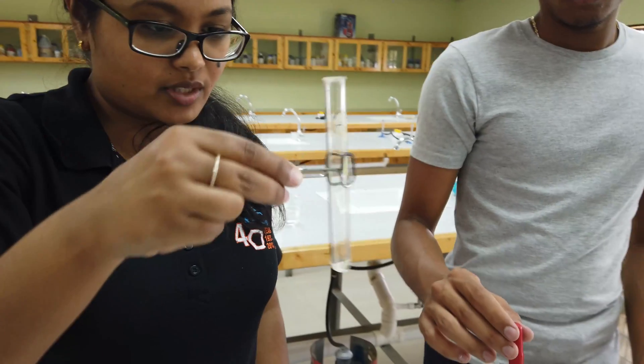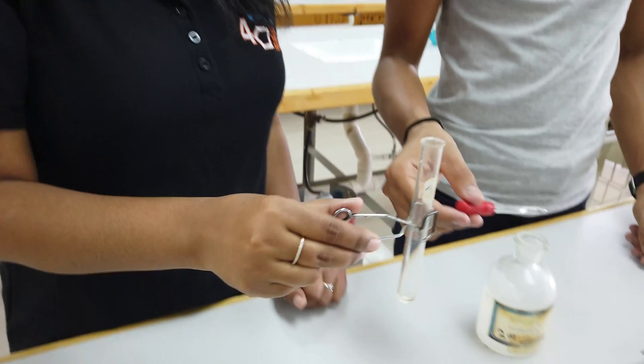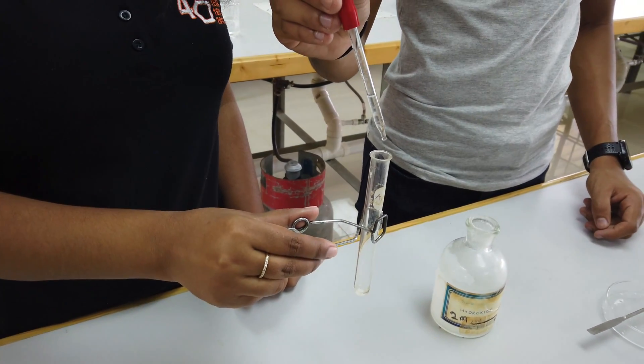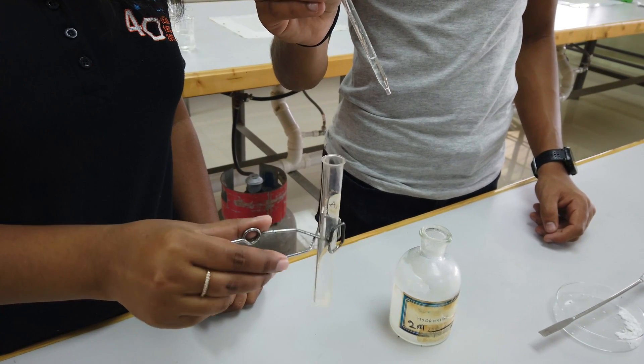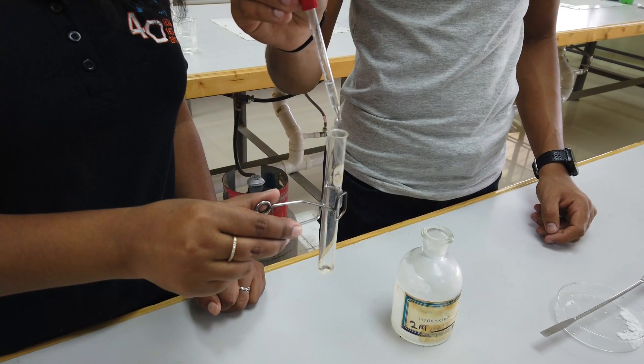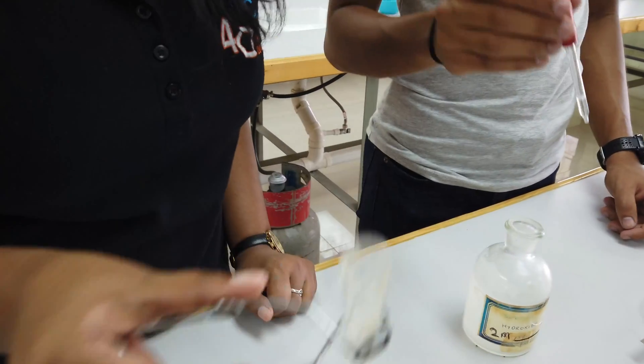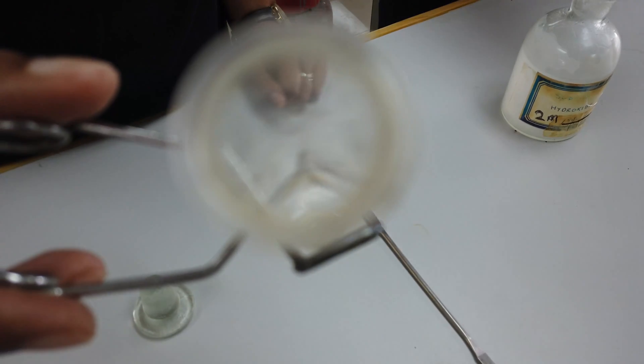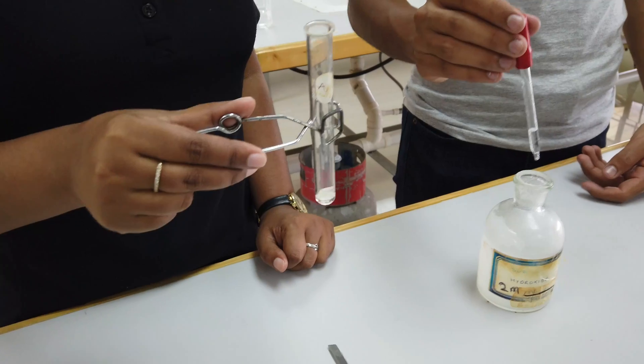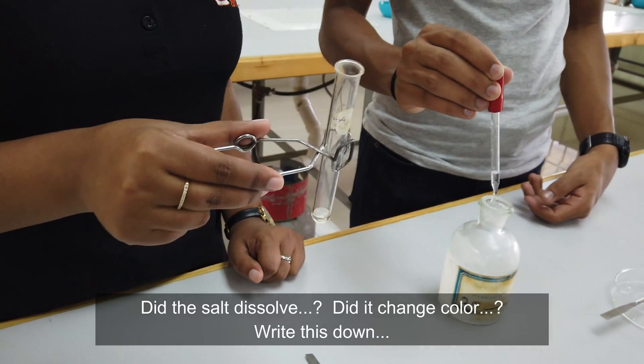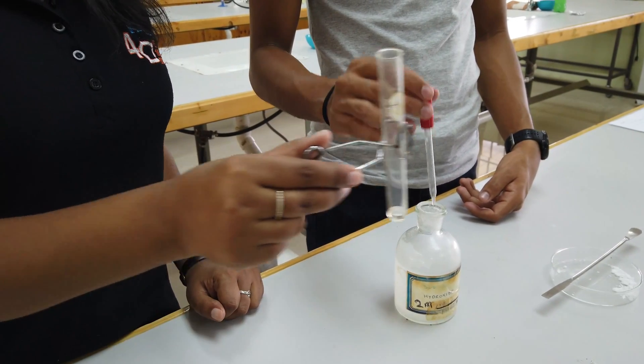Now because we used a little bit of salt, we're going to see whether a little bit dissolves - even just a little bit would be fine. You'll realize that some of the salt has dissolved. So we're going to note our observation: white precipitate was soluble in excess. That's the end of test one.